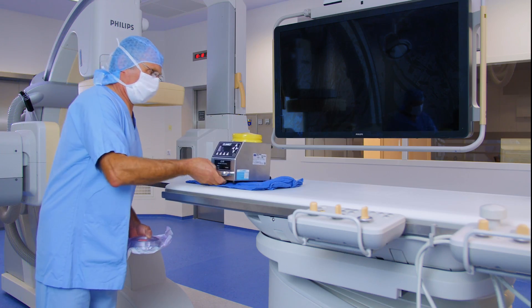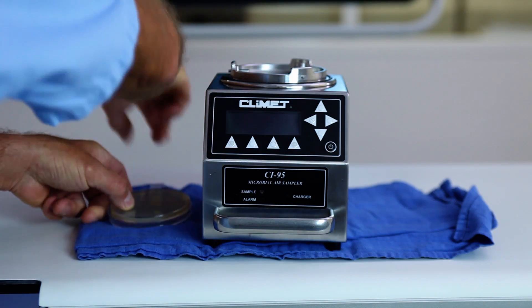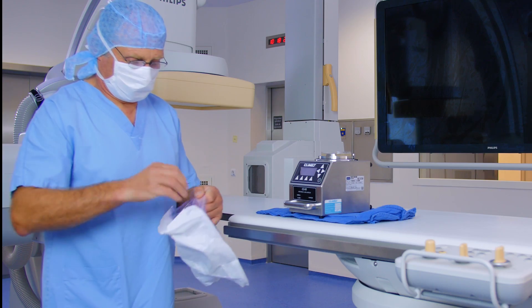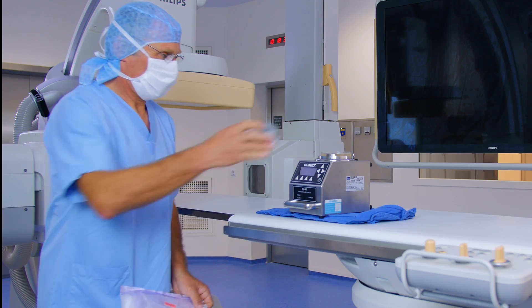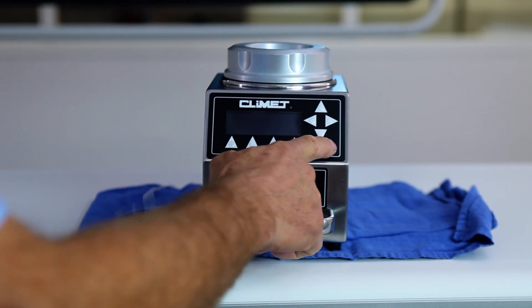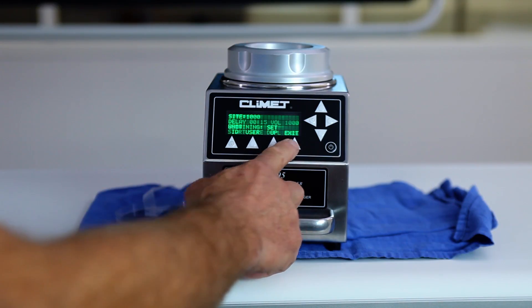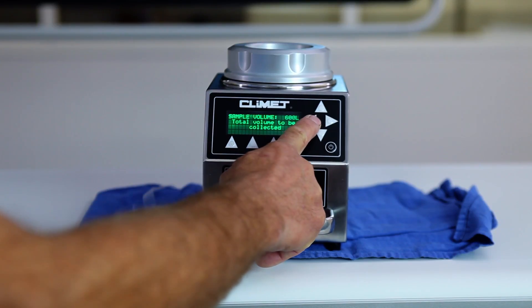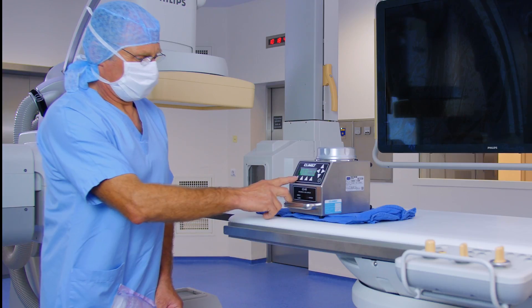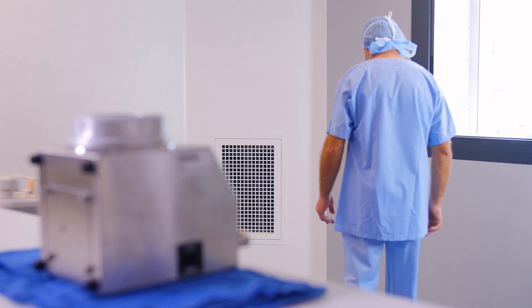Place the bio collector on a flat surface at a comfortable working height. Open the agar and position it in its place facing upwards. Then screw on the nozzle. Start the device and set the volume of air to be sampled: 1000 litres for M1 and M10 classes, and 200 or 500 litres for M100 zones. Keep still or move out of the area if the aerobio collector has a delayed start function.